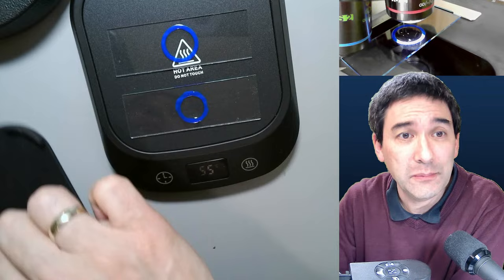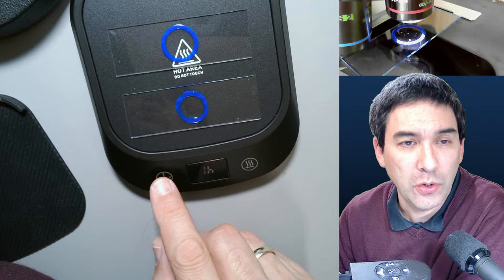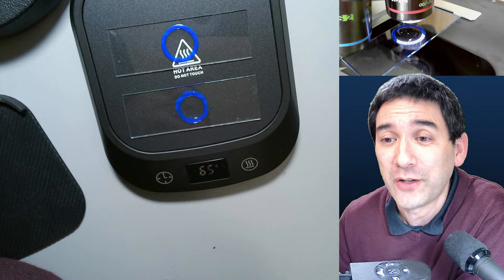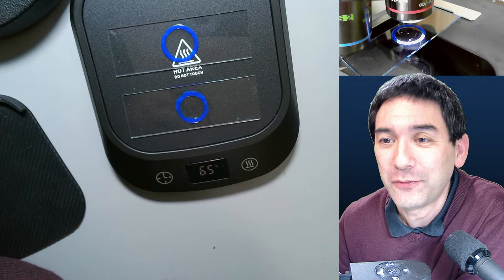You see why it's important to have a ring — it allows you to fill out the whole area and the liquid does not spread all over the slide. I'm also going to add the ascorbic acid. I'll go up a little bit with the heat. It goes faster if you take away the rubber pad and put it directly on the surface — the liquid evaporates faster that way. There's a timer and I can adjust the temperature.